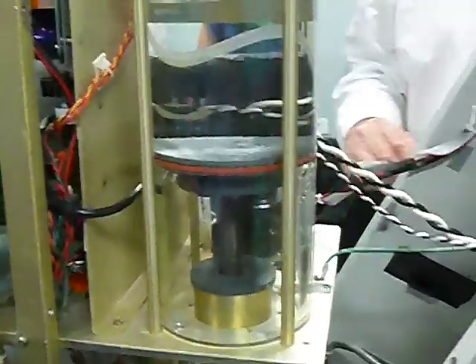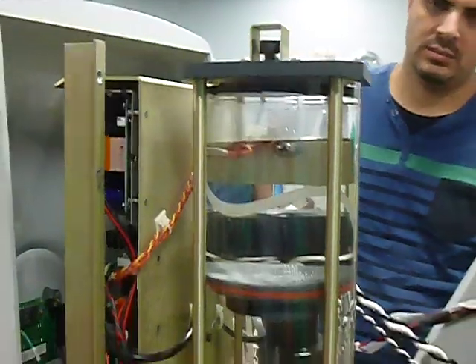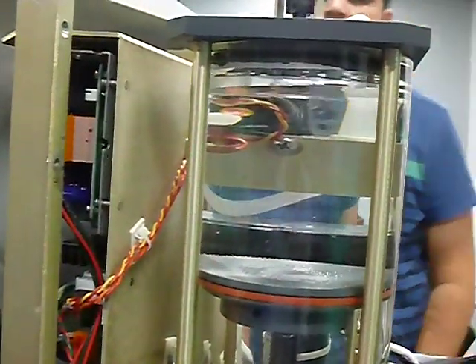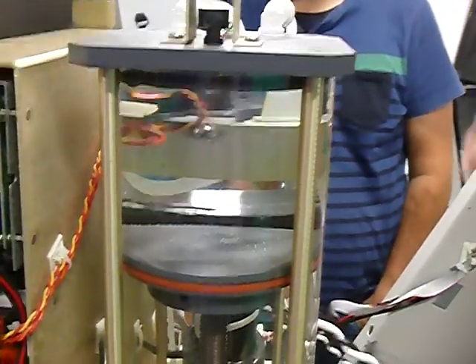I don't know why it's not, it should be working. We get it to new firmware. What is the delay? 10 seconds or something like that? The delay from when the motor stops? It depends on the program, how much you're taking in. If you're taking in 250, 500, it's gonna be internally set up, so you probably never have to worry about that. All right.